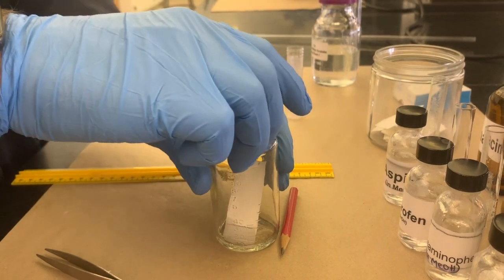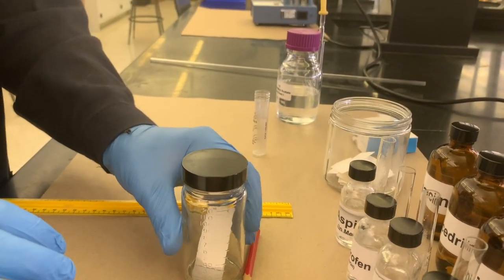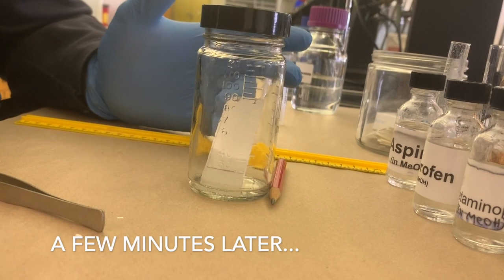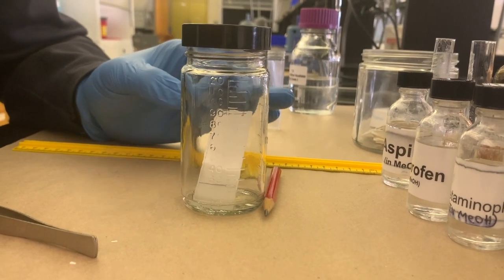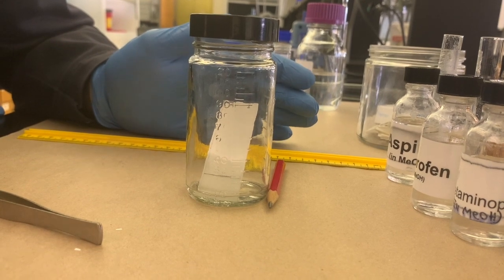You're going to put the lid on the jar, but make sure you don't make it too tight. You want to be able to get in there as soon as possible once you decide that the run is over. Don't allow your TLC plate to run too long by walking away or doing something else. You want to keep an eye on it the entire time that you're working with the plate. Otherwise, you might have to start all over again, and that's no good.